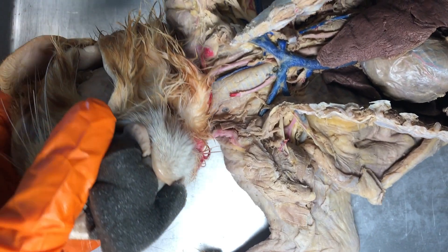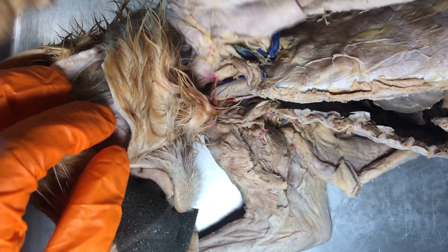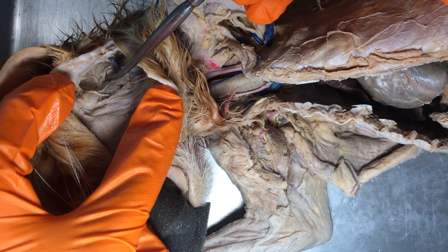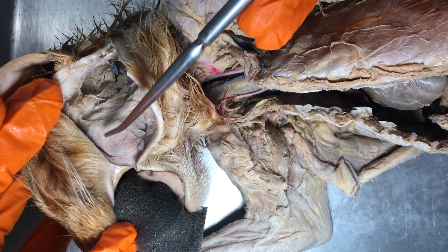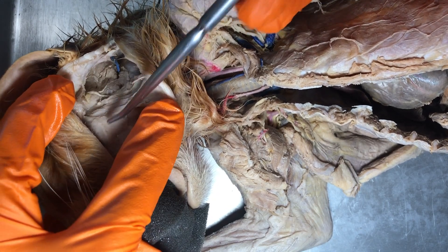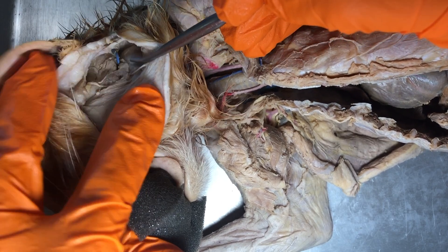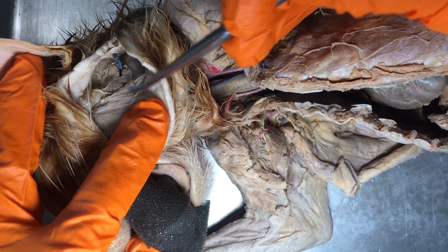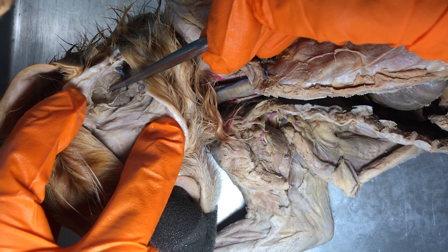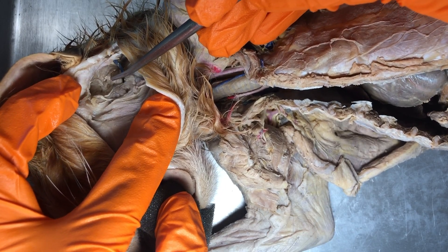The first thing I'd like to point out is in the head right here we have the left parotid salivary gland. This right here is going to be the left masseter muscle — you remember that from AMP1. You actually have to go more towards the ear, and that gland real close to the ear is the parotid gland, and because we're on the left side of the kitty, this is the left parotid gland.